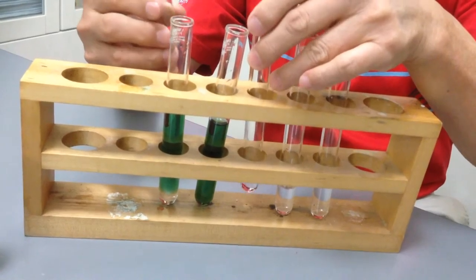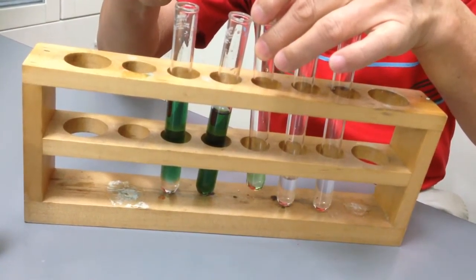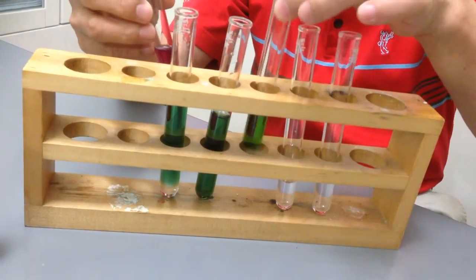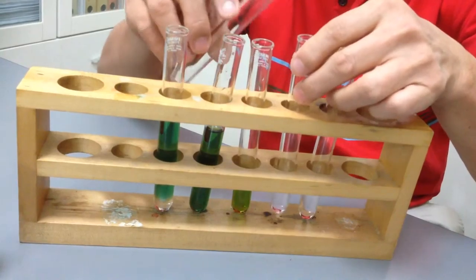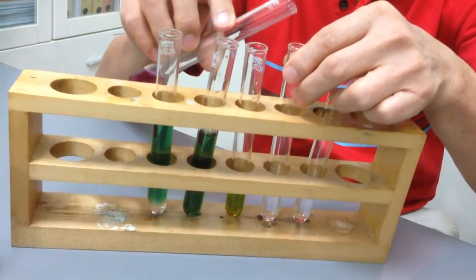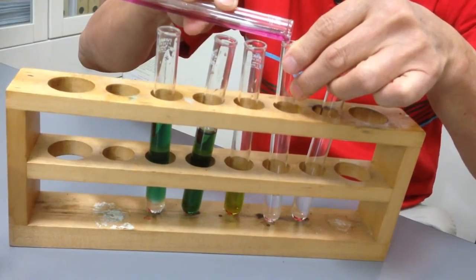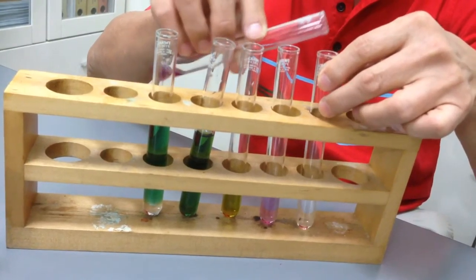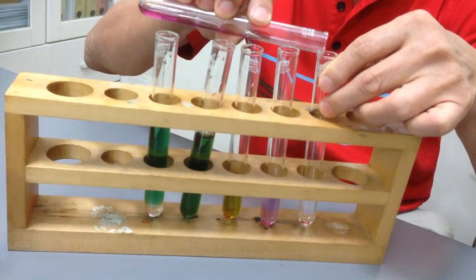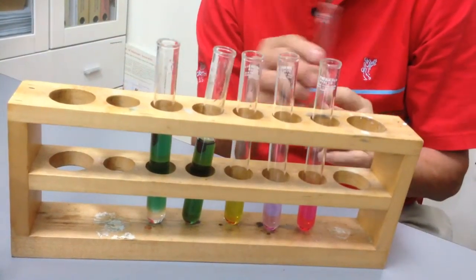And then we have another one. This one will turn green also. Then these two will be different. This is tap water. This is tap water. Tap water will remain pink. And therefore, this one, hydrochloric acid, will give you a different color. And it will give you red.